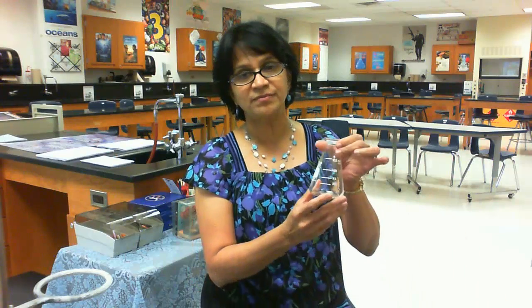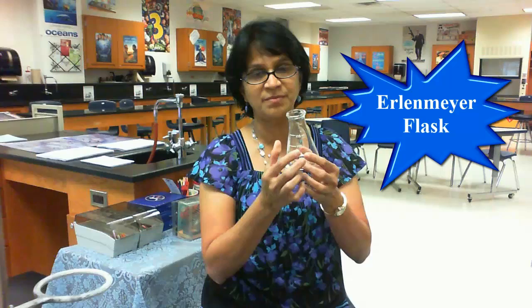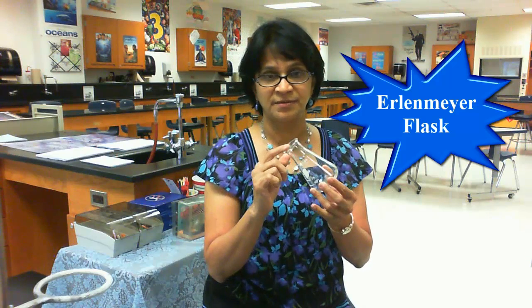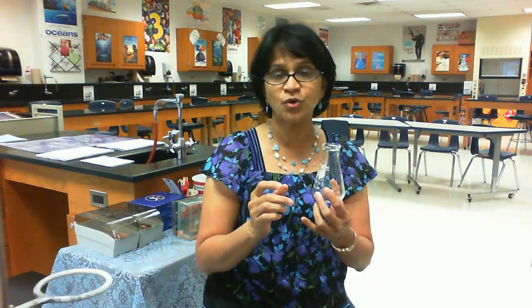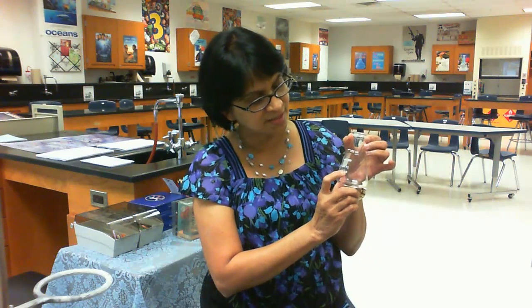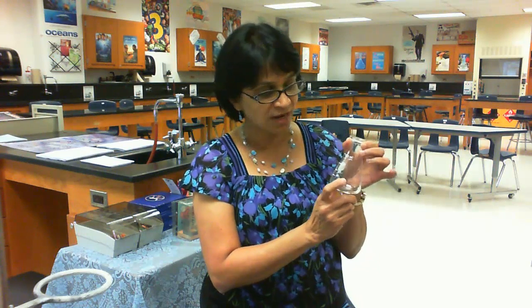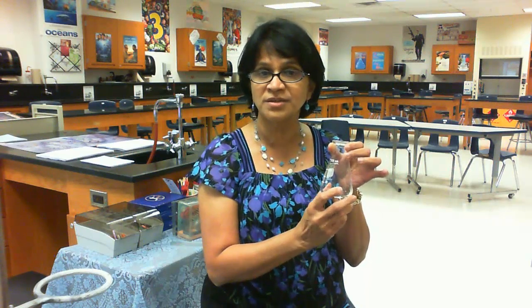The next equipment is called the Erlenmeyer flask. It has a small mouth, which means we can actually use it for storing chemicals for a longer period of time. We can use a stopper on the top for liquid storage. There are some markings here which are not extremely accurate, but they allow us to measure the volume of liquid approximately.